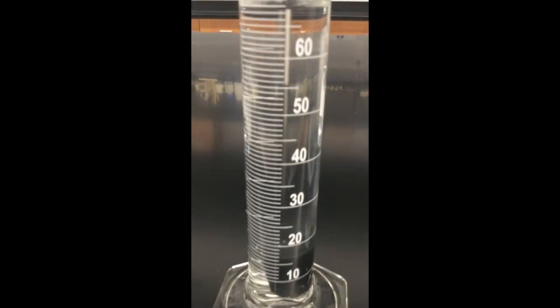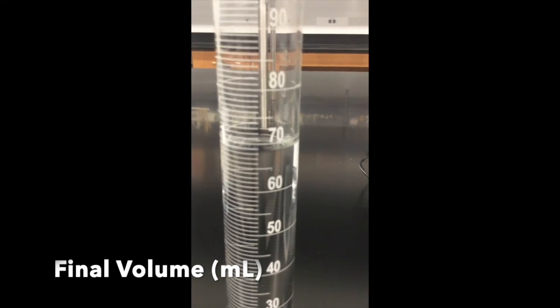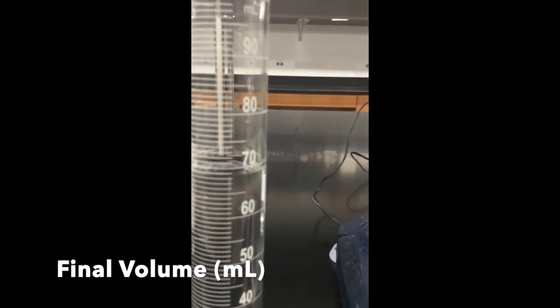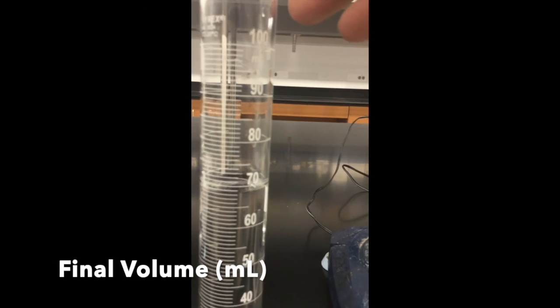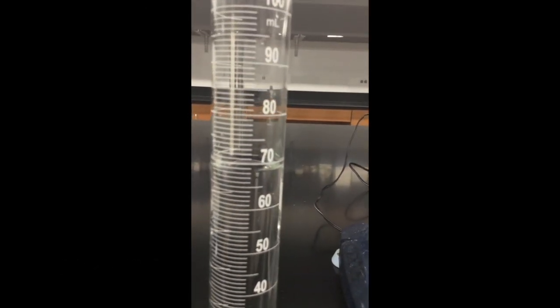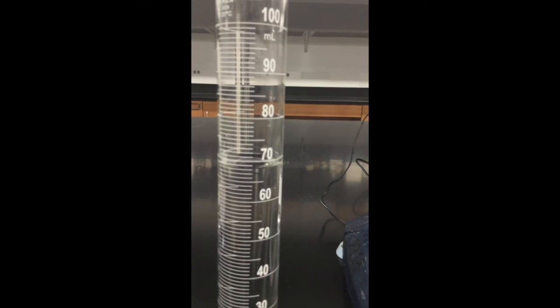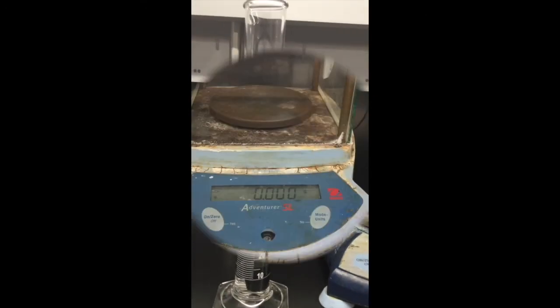You need to record the final volume in the graduated cylinder. You can see where the meniscus is. If you want, you can stop the video and see where the meniscus is on the graduated cylinder. This is trial 1. You need to record the final volume for trial 1 in the graduated cylinder.